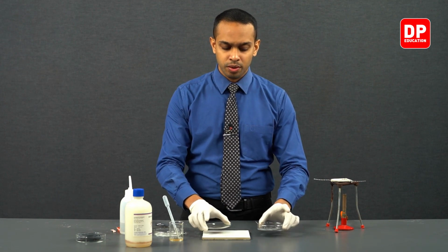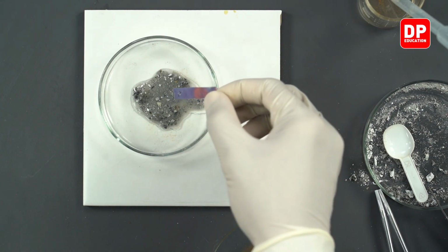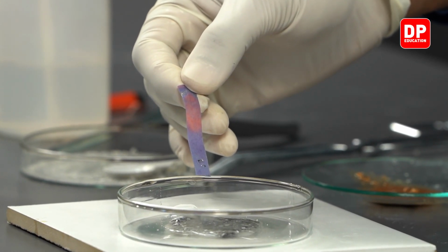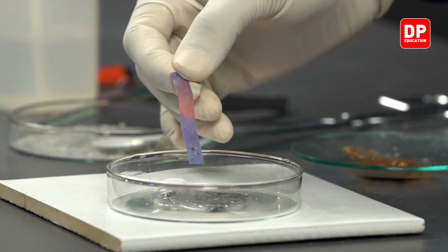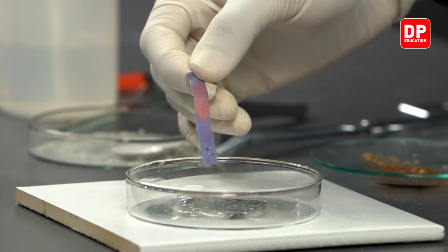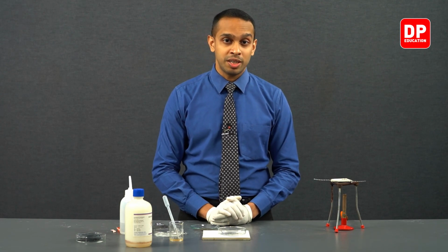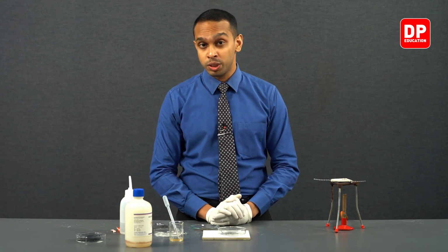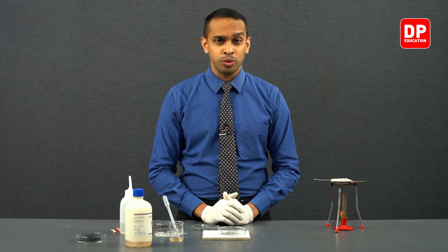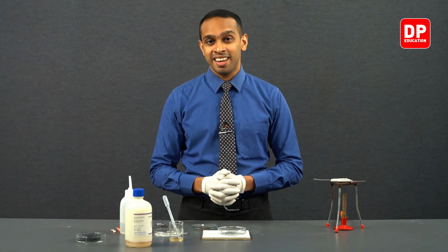And later on, we used a litmus paper to observe whether the litmus paper turns blue when magnesium nitride is reacted with water, and we in fact observed that litmus paper turns blue in the presence of a solution that is made with magnesium nitride and water. Magnesium nitride, when reacted with water, released ammonia, made the solution alkaline, therefore turned red litmus paper into a blue color. So this proves that we have nitrogen in our atmospheric air.